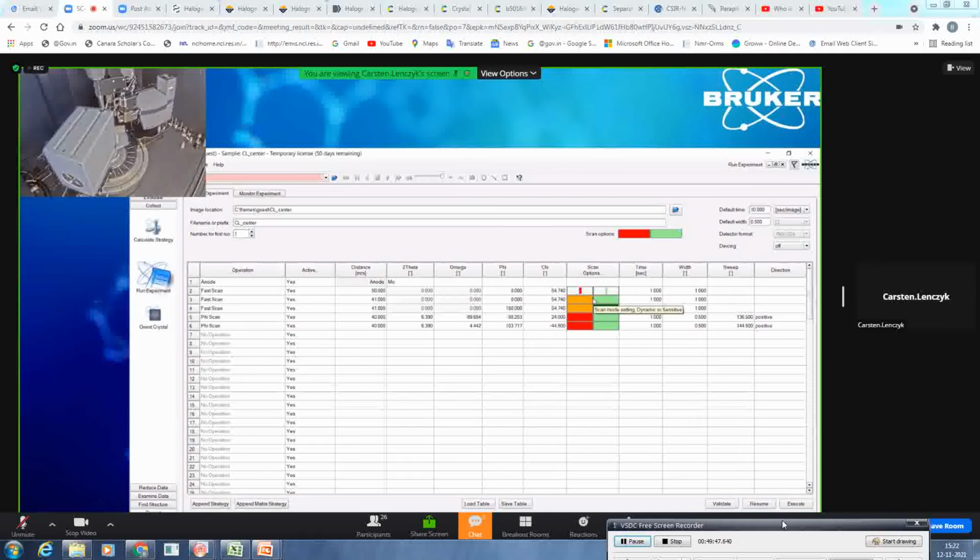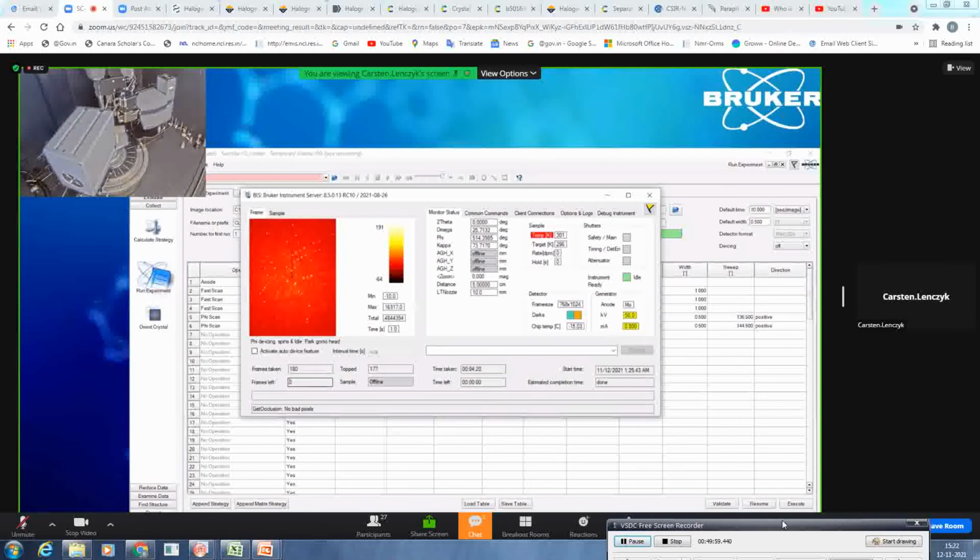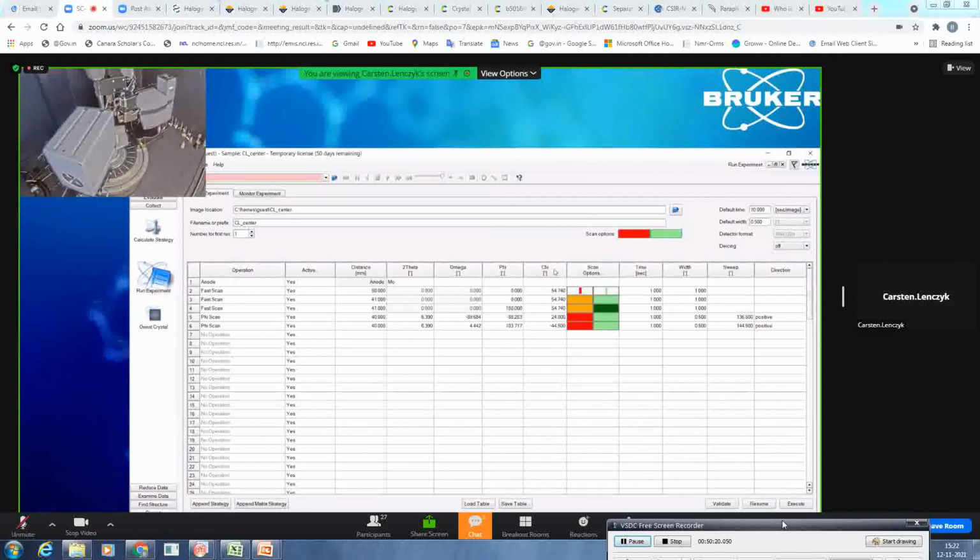Not only with the additional information you get, you can also use fast scans to re-import reflections which have been topped in your experiment. So if you look closely at the BIS, you will see here it collected 180 frames out of which 177 feature at least one reflection which was exceeding the dynamic range. So this can't be or will not be accounted in your data processing later on. So to get complete data, you will do the fast scan, and in the scaling later on, you can re-import those reflections which have been topped from the fast scans you collect here.